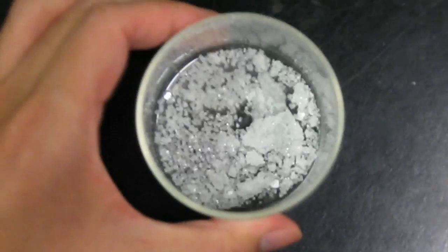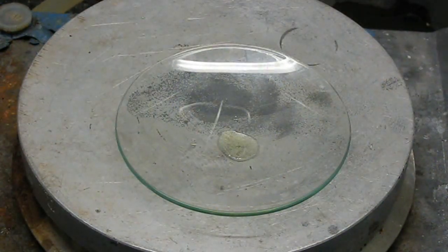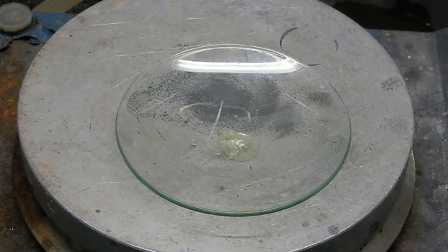Normally to dry chemicals you just leave them out or heat them up. But some chemicals, like this dysprosium nitrate, are so hygroscopic that they continually absorb water from the air and remain liquid even after months. Even worse, you can't heat it up to dry because it decomposes even with slight heating.